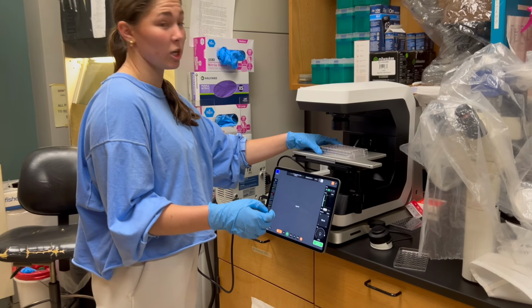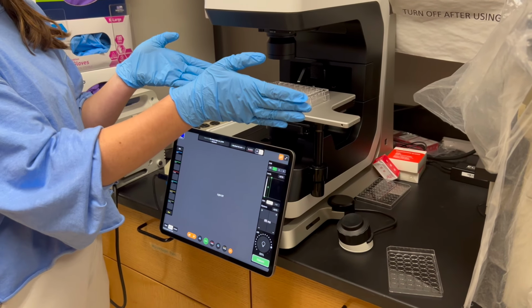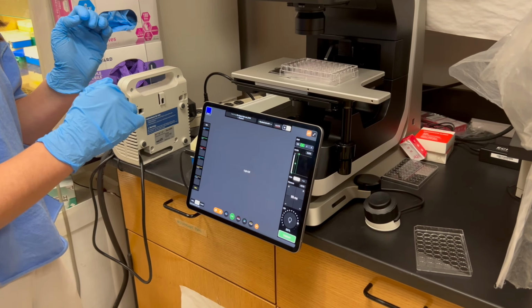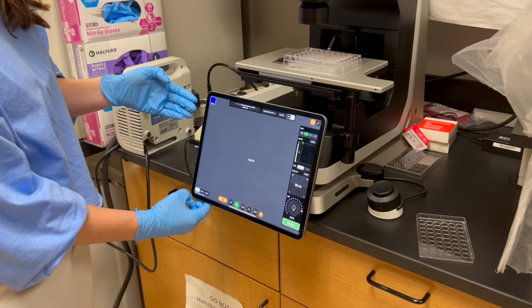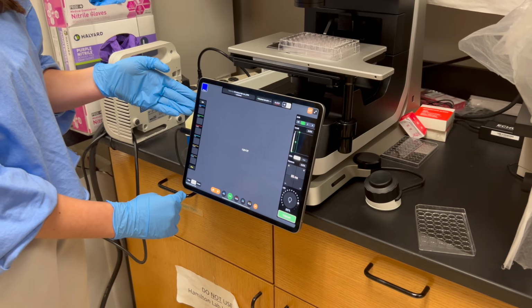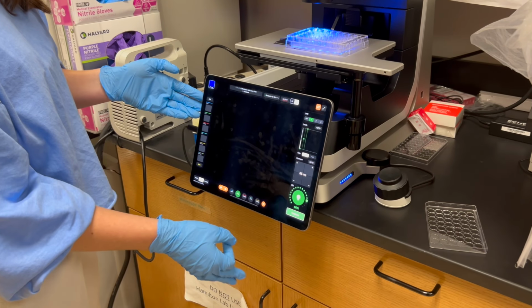So we've put our plate onto the microscope, making sure that a well is within the visual field of the lens, and we've taken off the cover. So for our purposes, the best thing that we can do is to visualize this using an overlay. So what you're going to do is go from single to overlay down in the bottom left-hand corner of the microscope. And first you're going to be on FITC, and so this shows you your live cells.